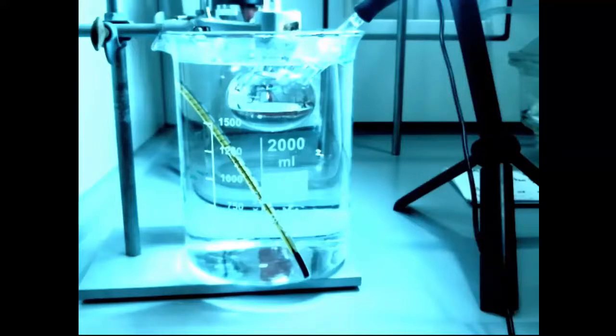It's about to do that sometime now. Okay, it's taken a bit longer than I thought it would. It's somewhere around here. Here it goes. That's me letting the pressure back in again. So we can see it doesn't boil at 40 degrees, even under fairly good vacuum. It's quite a good pump that we've got here.